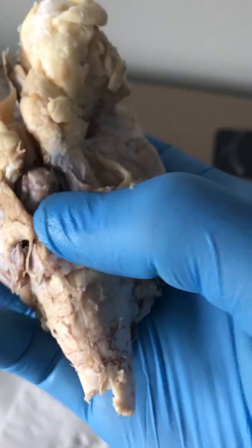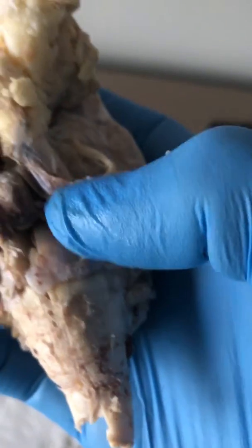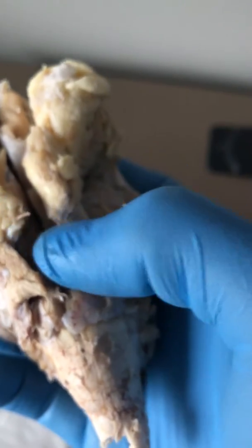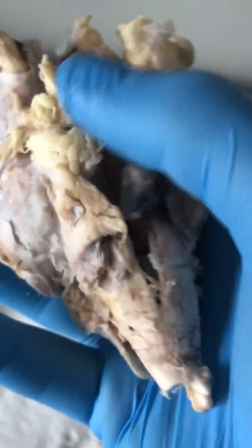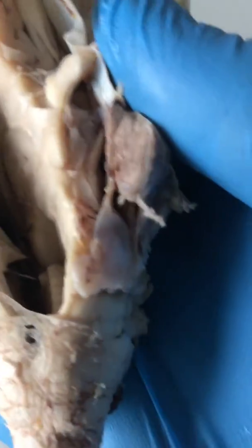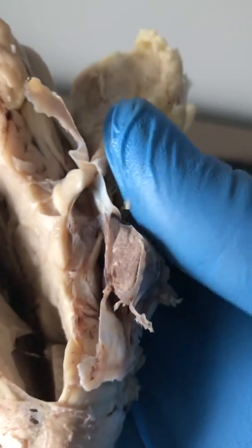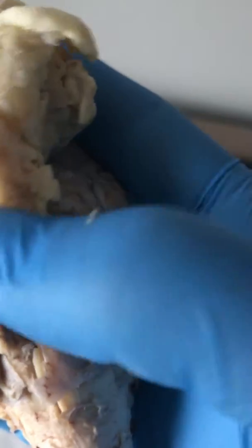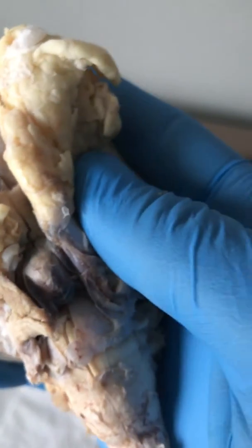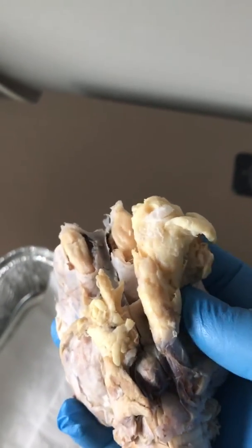In here, we're going to have the oculomotor nerves, which would be underneath that, along with the trochlear, trigeminal, which would be lower than trochlear, and the abducens, which would be underneath here. So it should be kind of able to see it right there. It's really tough, but there are some nerves under there that would run under, and as you can see, there's some more stuff that's been cut right there that kind of would line that out a little bit better for all of the nerve systems.